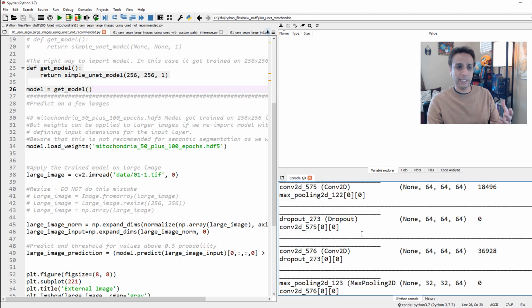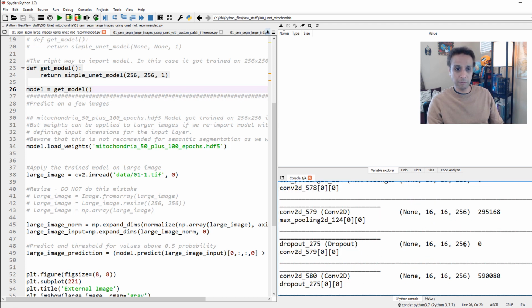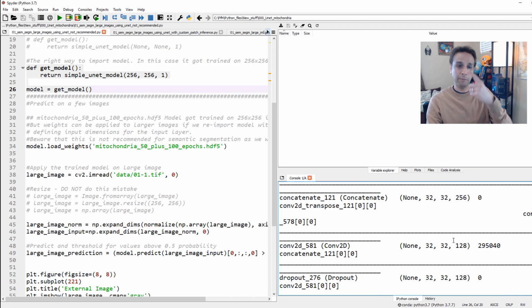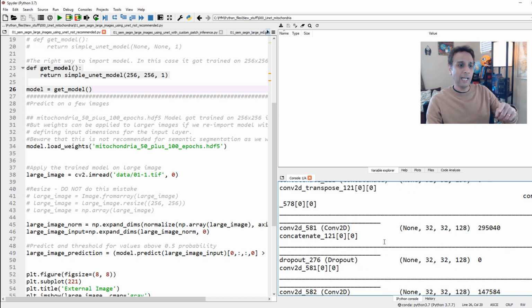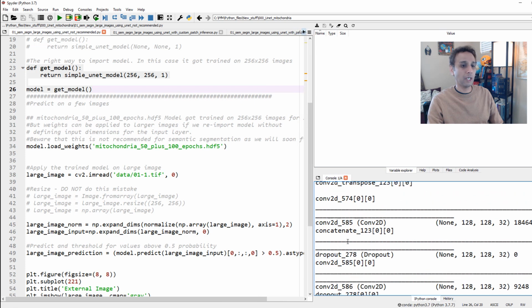So this gives you a nice idea of exactly what I was doing, going all the way down to 16 by 16 by 256 and then upscaling it back, right? This is your classic U-Net, and concatenating in the middle between these connections. That's pretty much it. So no tricks over there. So not much to talk about here.